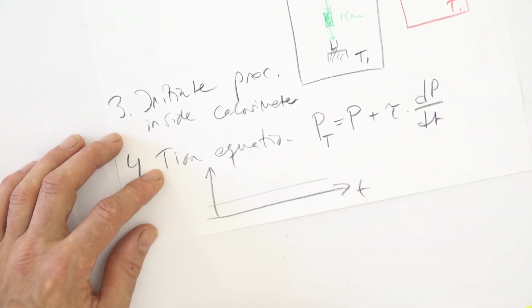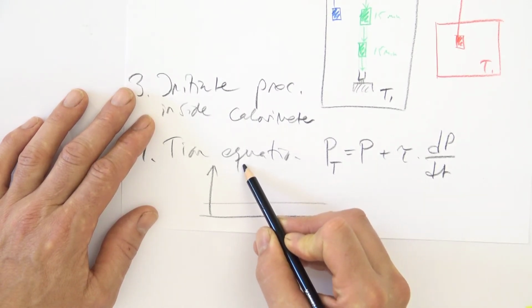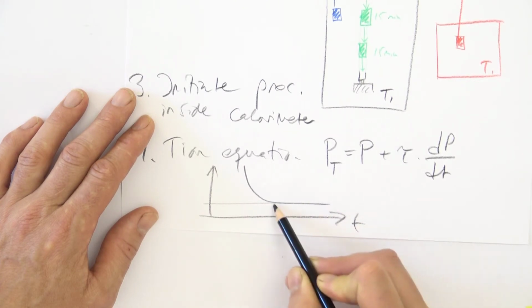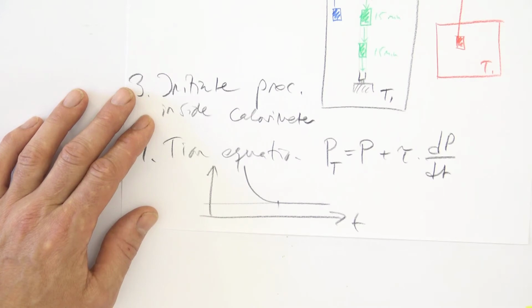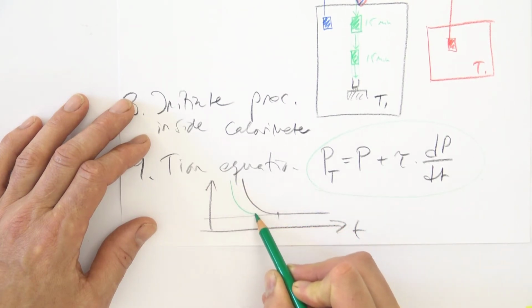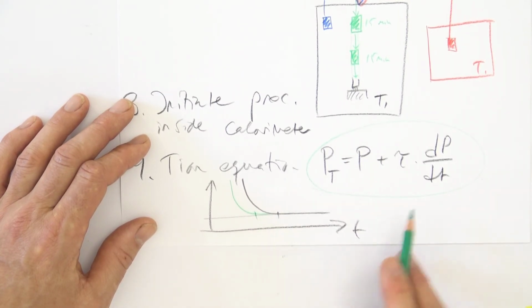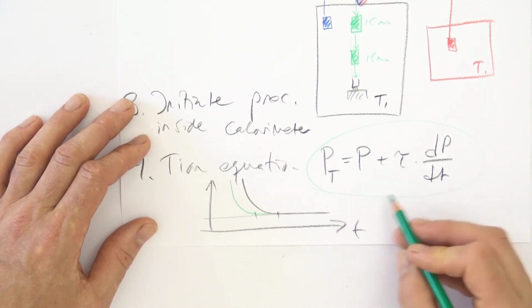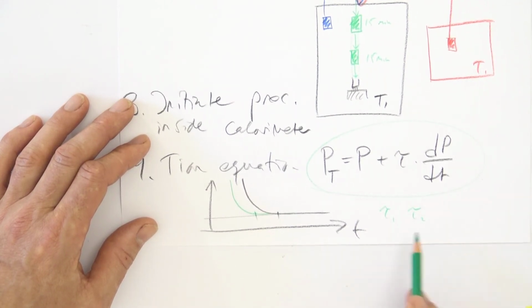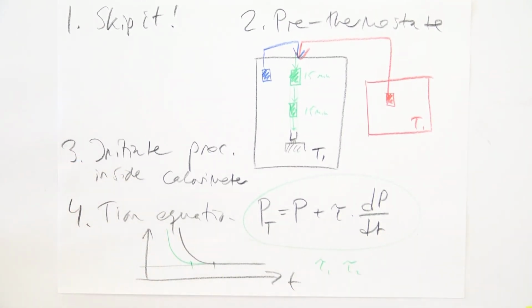Like this here, we have this isothermal power, let's say of the insects that we're studying, and the signal initial disturbance decays like this. So here we can measure the true thermal power. The Tian corrected curve will instead look something like this. So here we can measure the true thermal power slightly earlier. So it's not a perfect correction, but it's at least better than not using it. There are other models where you, for example, have 2 time constants, and those models are better. And there are other more general models that can be used to correct for the thermal inertia of a calorimeter.